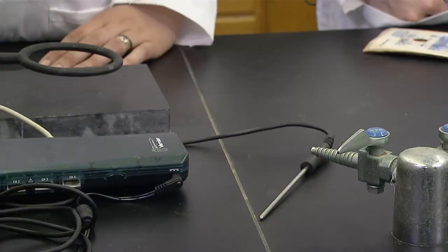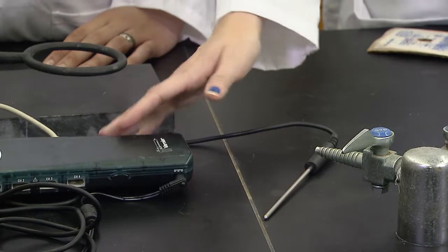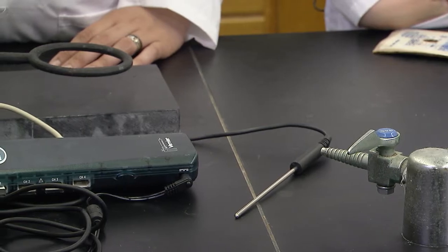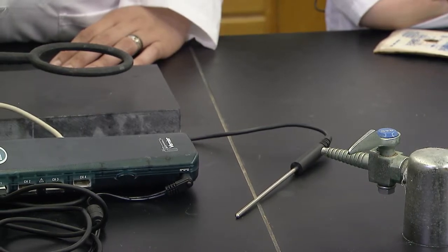Sophie, the hydration reaction takes a long time, longer than we have for lab, so this way lets us get to the answer quicker. We will be using the laptops with LabPro and Temperature Probe to measure the change in temperature. Check out the How to Set Up LabPro with Temperature Probe video for detailed instructions.